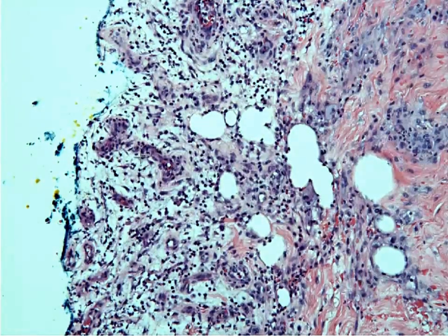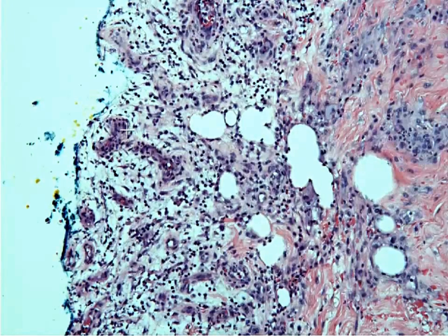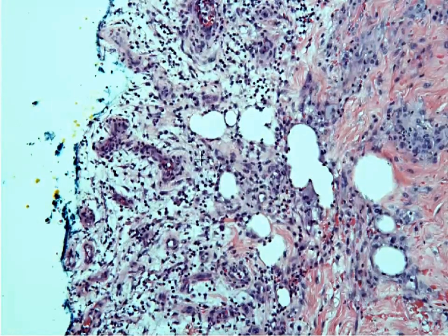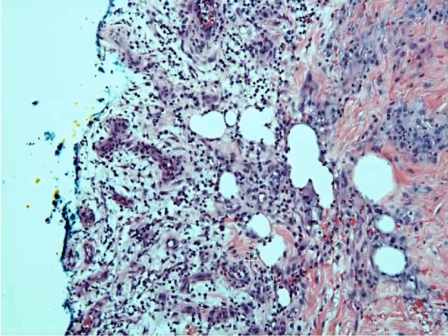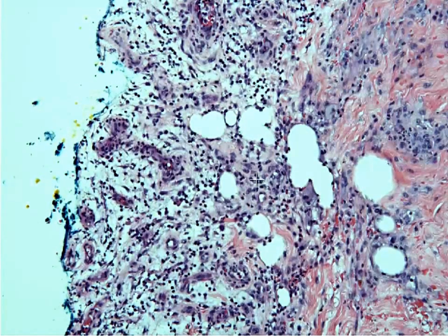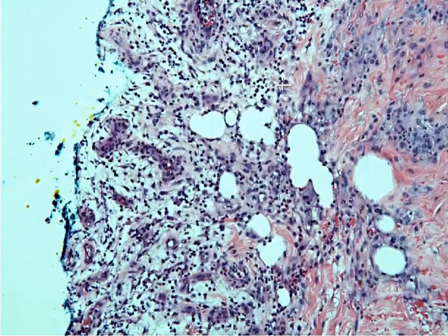Here you can see small blood vessels — capillaries — growing into a loose fibroblastic response, which is trying to repair this damage, and there are a lot of scattered inflammatory cells within this.